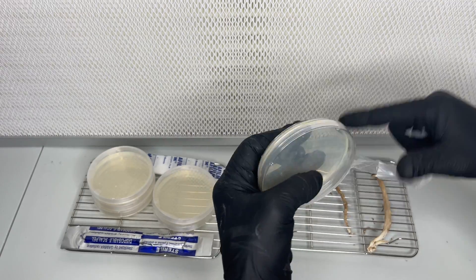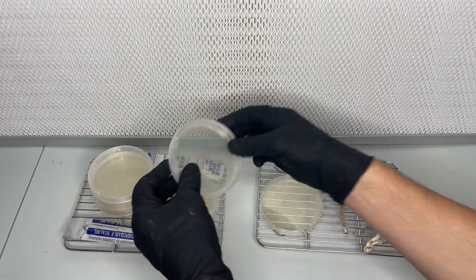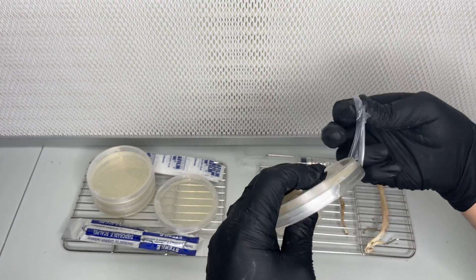Next I made a batch of agar plates so that I could transfer the tissue of the mushrooms to the plates and hopefully grow the mycelium.